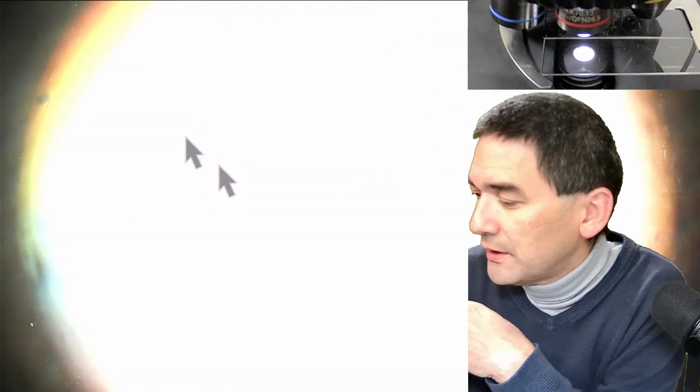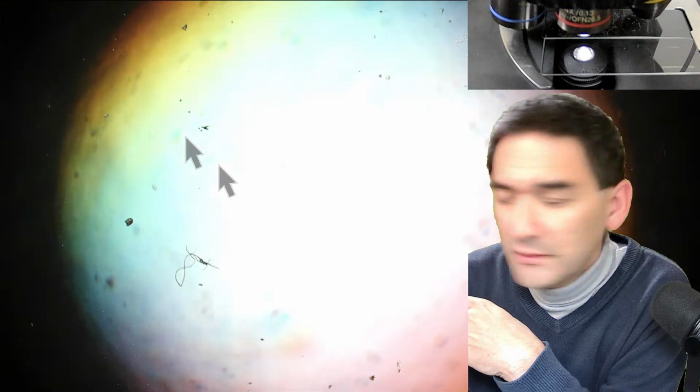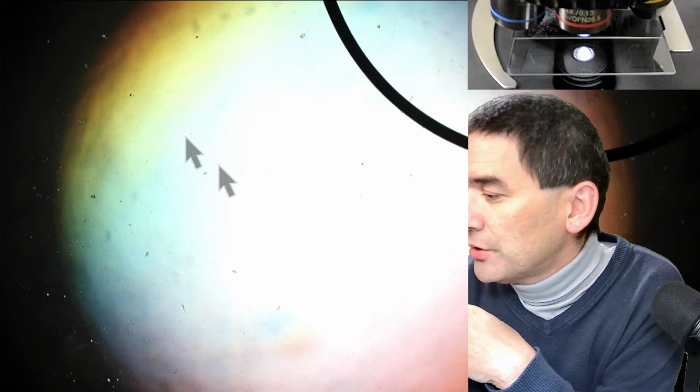Okay, I have to find this. This is now the challenge. I have to find this thing. So I need to go to the 20 times objective. I need to find the scale. We've got to be a little bit patient now.